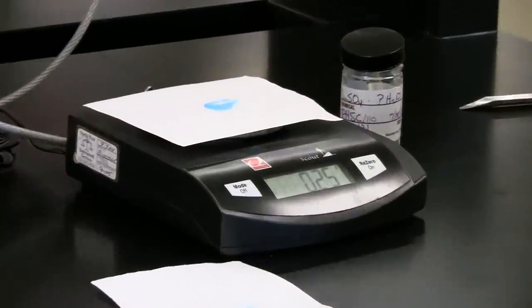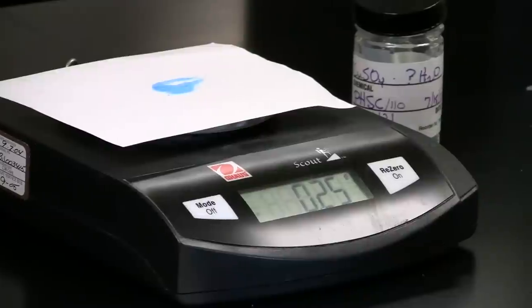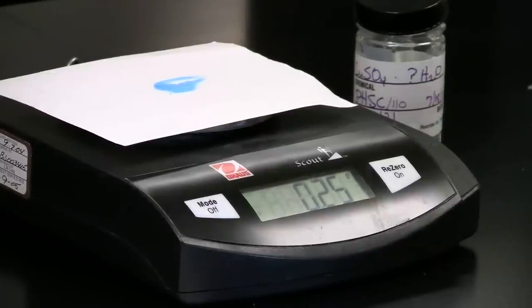The electronic balance reads out the correct number of significant figures for you, so record all digits listed on the display.